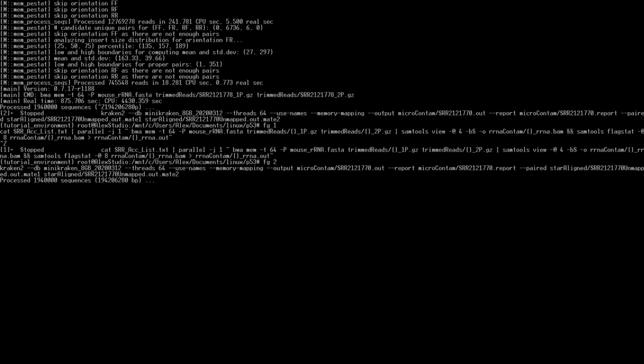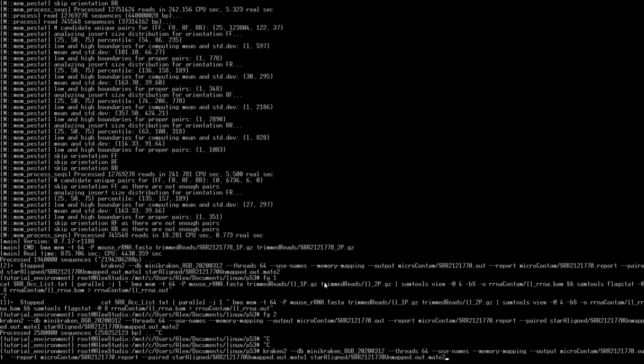So when looking at Kraken, this is really helpful. If we were to spawn, like in BWA, we're only spawning one job. Here, that's not that big of a deal. But for Kraken, since it doesn't use that many cores, if we wanted to launch all 12 of ours at one time, we could do that. The only downside is without specifying memory mapping, so without telling it to not load everything into memory, it's going to try to load that database into memory 12 different times. And we don't want that. Not sure why it's taking so long. Should be way quicker.